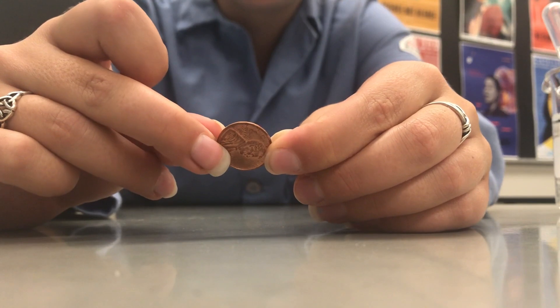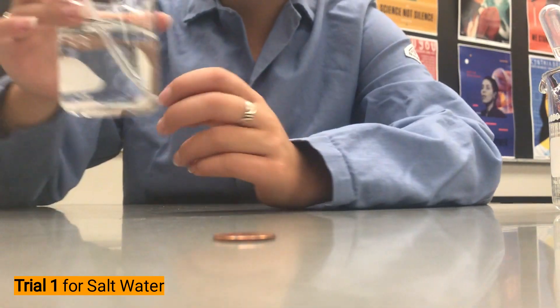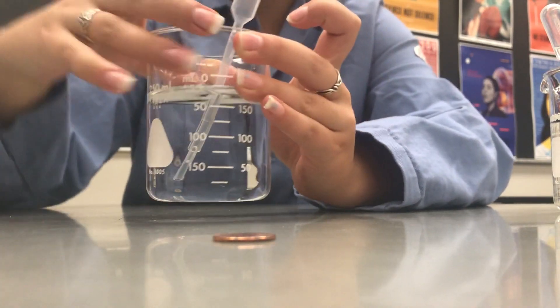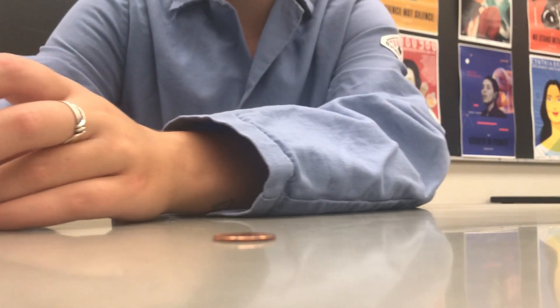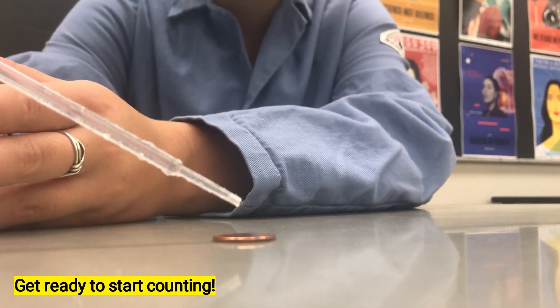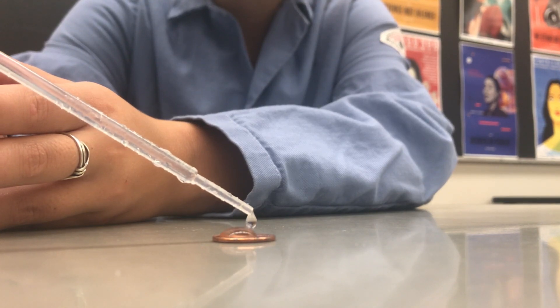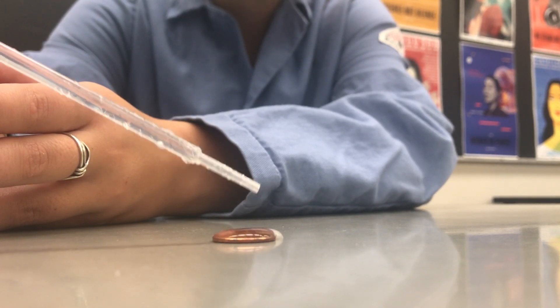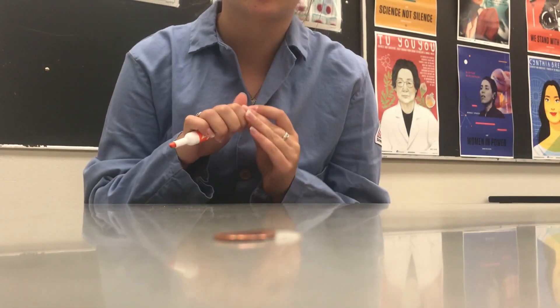I've wiped down my penny and removed any residual water from our first part of trial one. Now we are going to complete trial one for the salt water — I've added salt to this beaker and we will be dropping just as we did for the water, but this time it is salt water. Again, counting until it overflows. We would record that number into our data table.